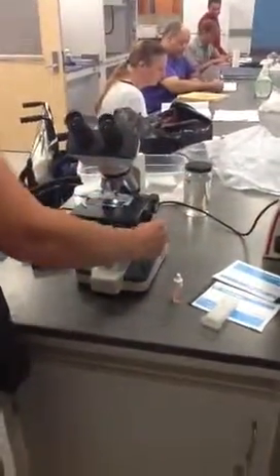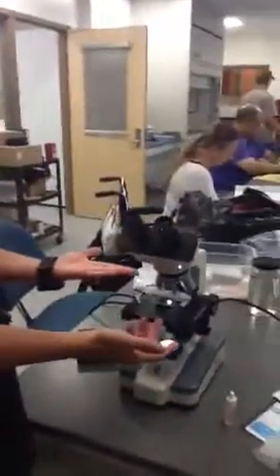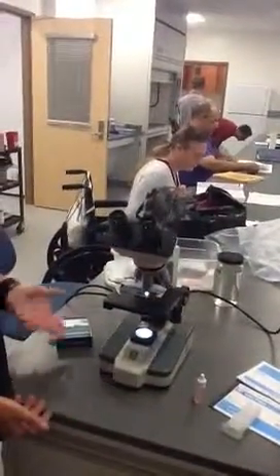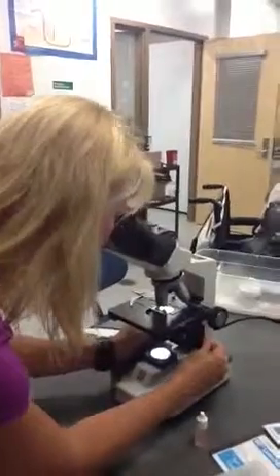You also want to make sure the light on the slide is projecting through where your specimen is. Find it on your coarse focus — some slides have pointers to show where things are, others don't. Once it's in focus you can draw what you need to or move on. I don't move it up and down once it's in focus. Slide in the 10x lens and all you need is fine focus to get it in place. Then the 40x lens is going to be the highest dry magnification you'll use, and again just fine focus to get it in place.